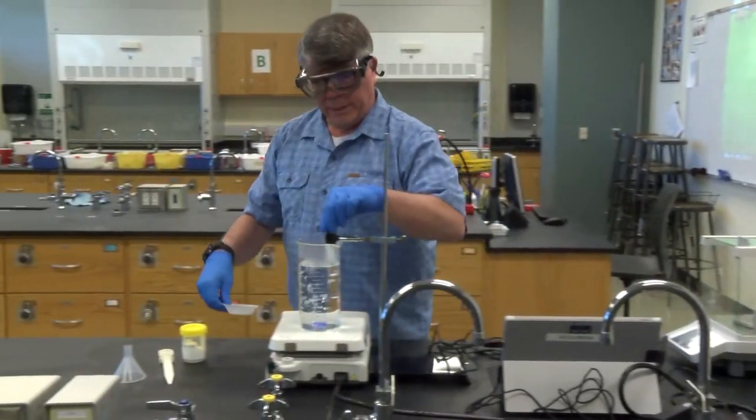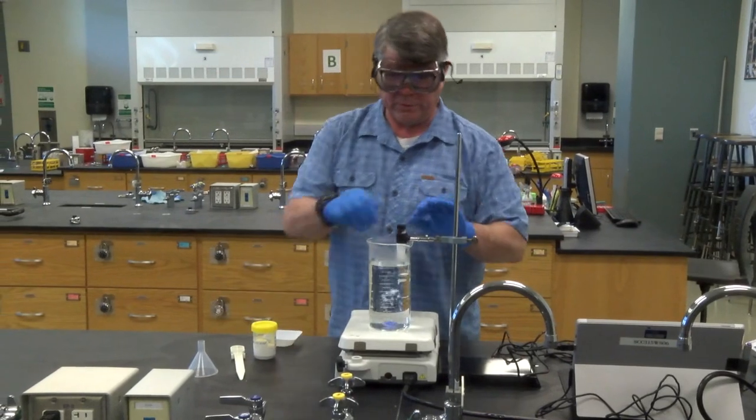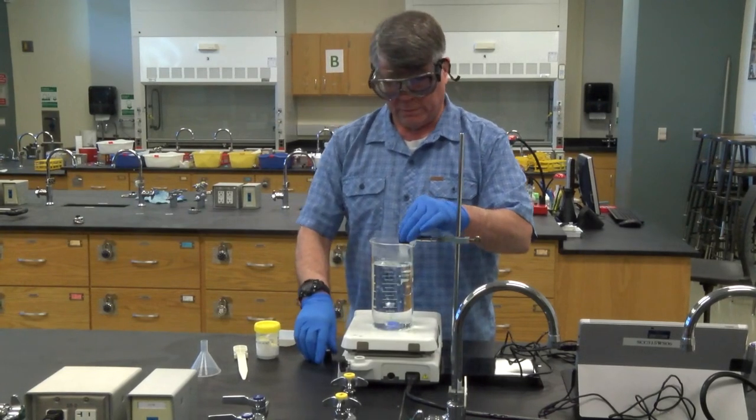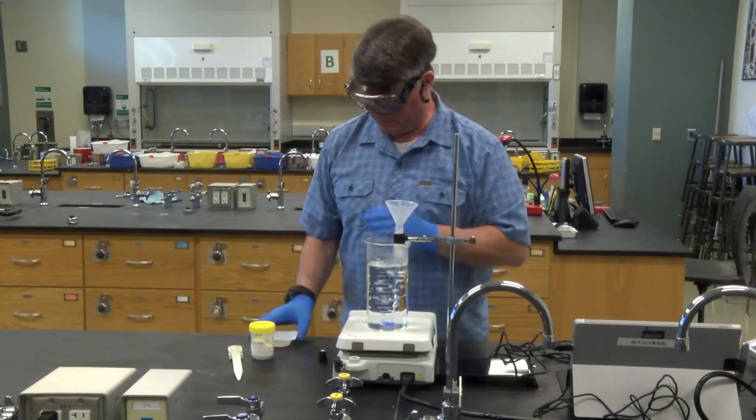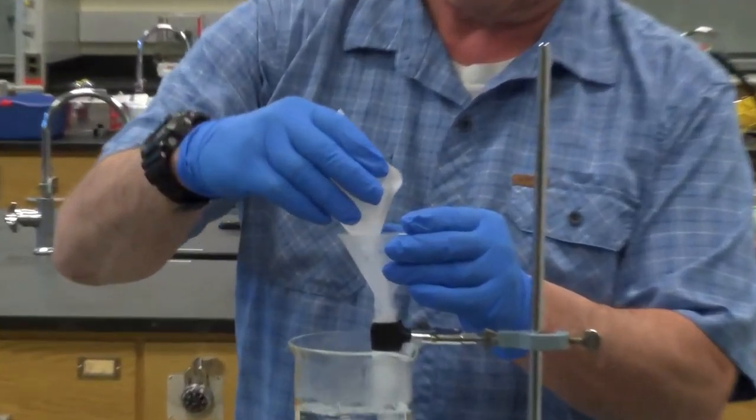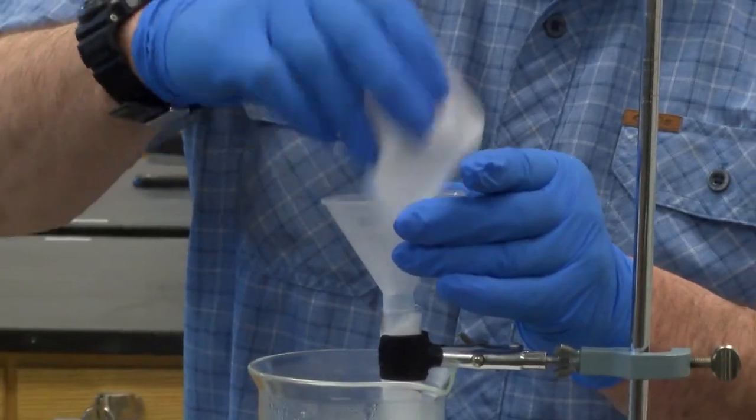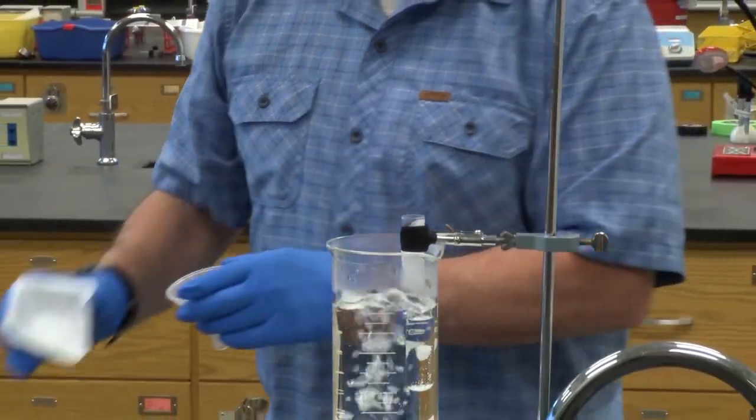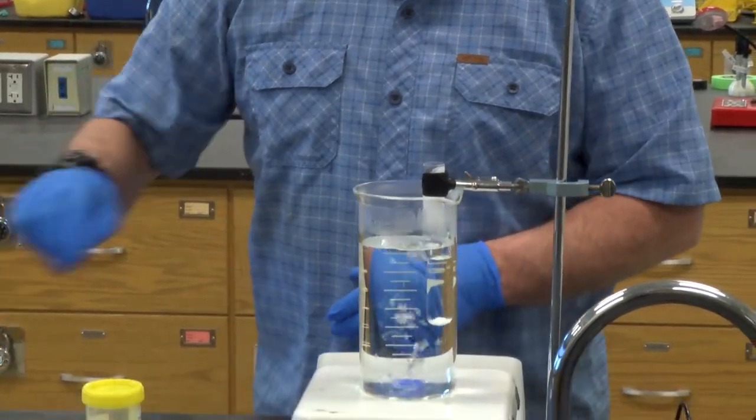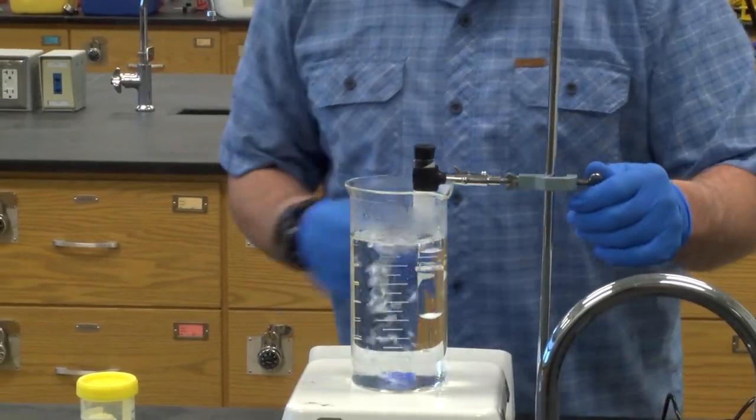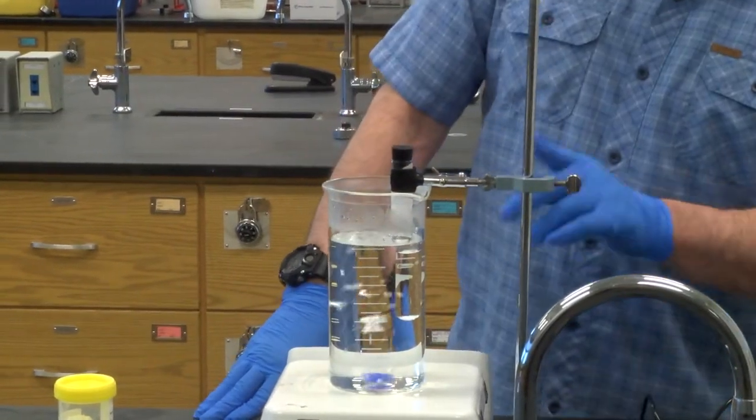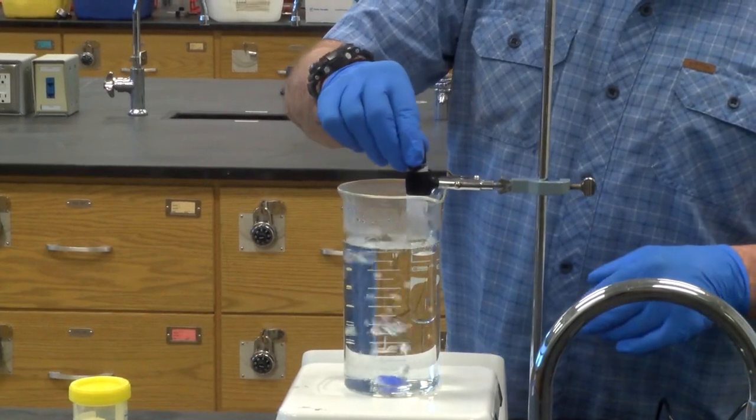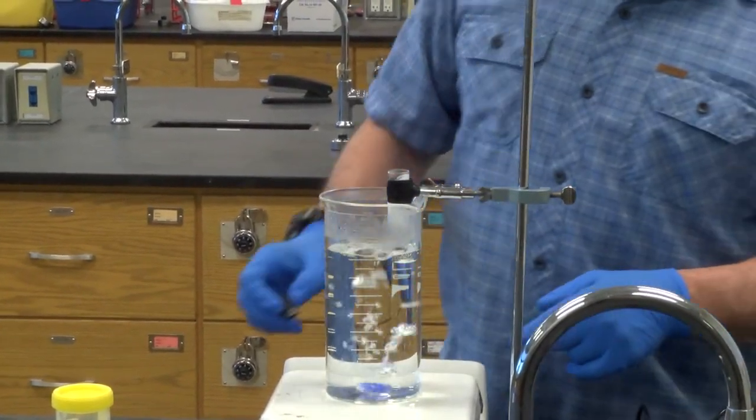Take it out. And even though my solid organic solvent has not completely melted, we can still add the unknown to it. Funnel, weigh boat, and just dump it right on in. Make sure you get it all. And now we can see it's not completely melted. There's some of the solid organic solvent up here not melted. We need to wait for that to all melt. Everything else is pretty much melted, but it'll go. So we'll just leave it there.